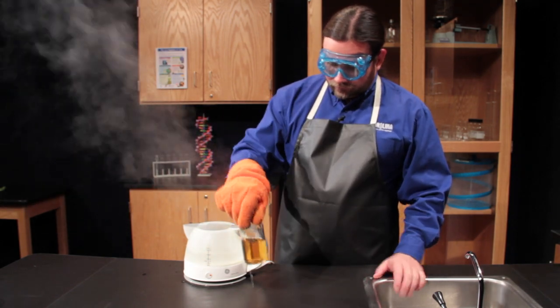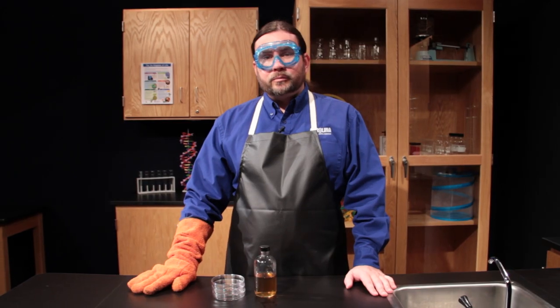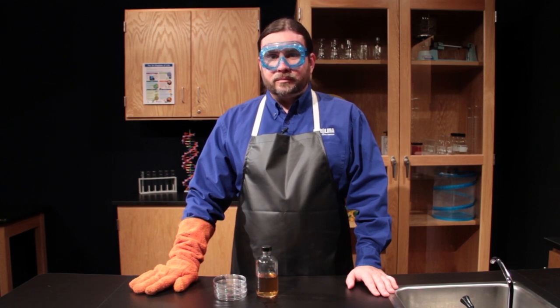Set the bottle on a heat resistant surface to cool for about 15 minutes. If you try to pour the plates while the agar is still too hot it can cause them to crack and warp, plus it can cause condensation to form on the lids.